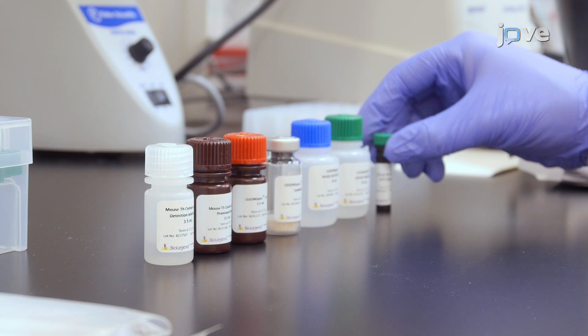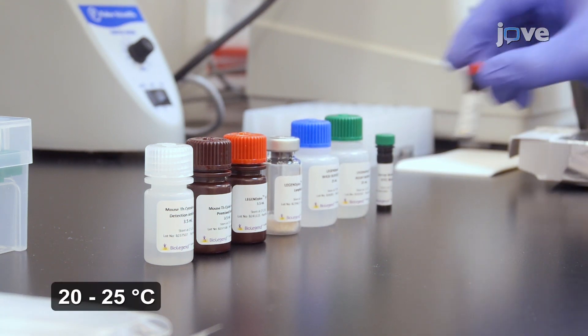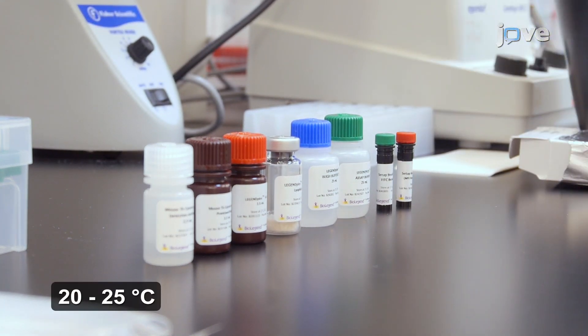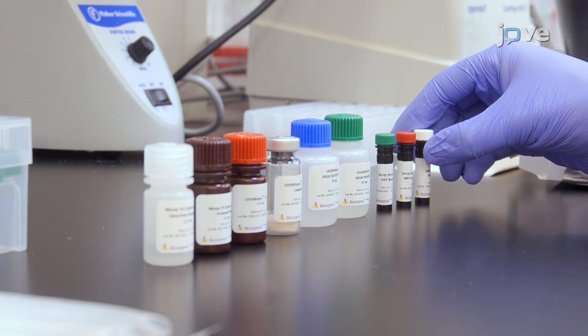To perform the assay, allow all reagents to warm to room temperature before use. Polypropylene filter plates are used in this demonstration. It is absolutely essential that the plate be kept upright during the entire assay procedure, including the washing steps, to avoid losing the beads.